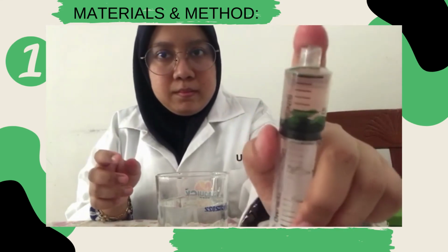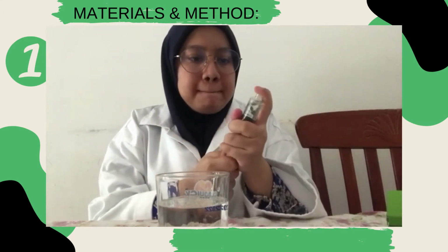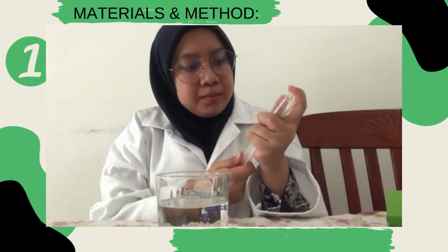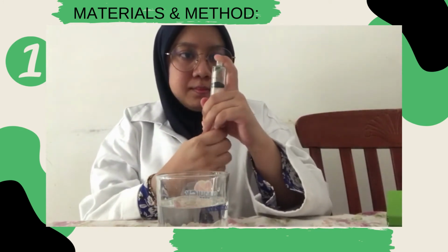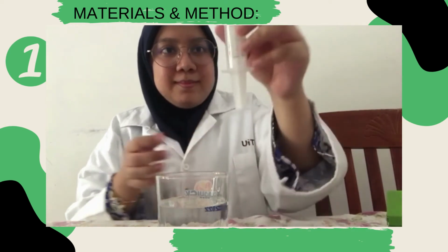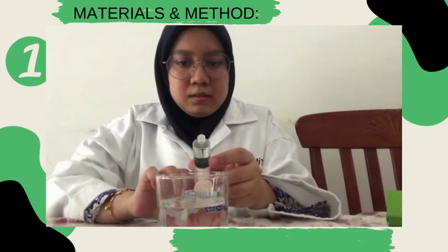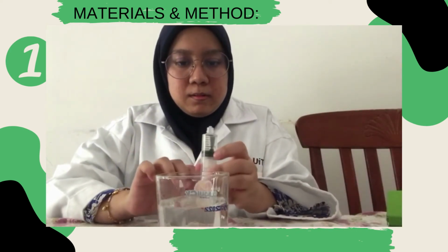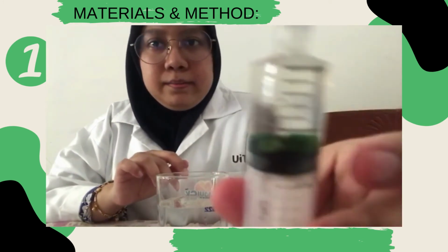Hold the vacuum for a few seconds and then release the plunger, letting it snap back. Some of the discs should begin to sink. Repeat the previous step several times until all of the discs have sunk to the bottom of the solution. We need to tap on the plunger to release the bubbles in order to make all the leaf discs sink.